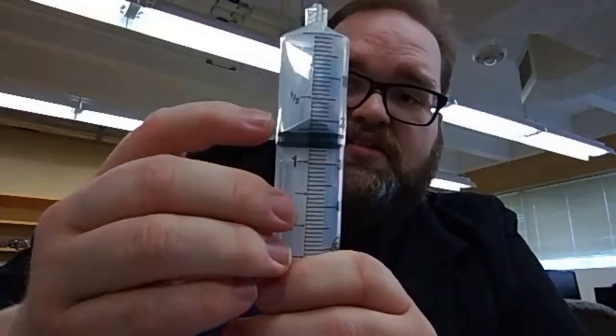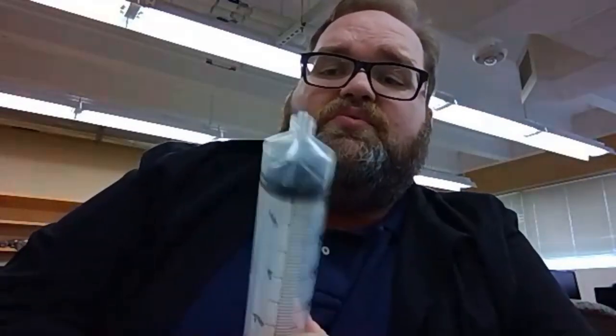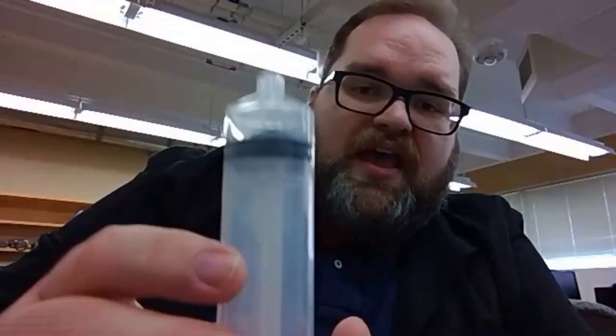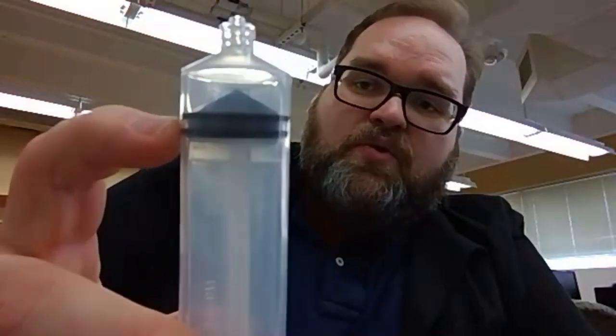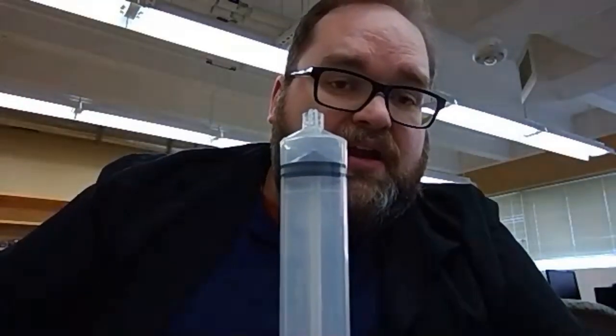I'm going to show you a little bit about how to read a syringe. You'll notice that in the syringe itself, it has a peak. That's to account for the meniscus of the liquid, but also for this funneling portion of the syringe at the top where the needle would normally go. We need to account for that in all of our measurements. We're going to measure from the top rubber stop — right where my fingernail is. That's where we're going to take our readings from. Please remember, you must be consistent about this, because any loss of consistency is going to throw your readings off in some of those further out significant figures.